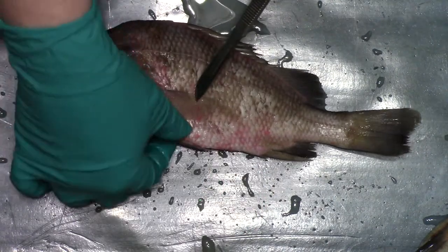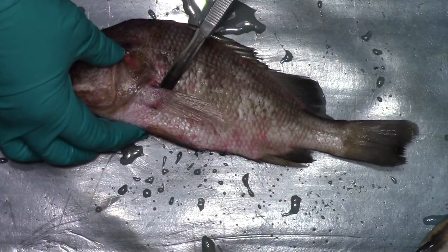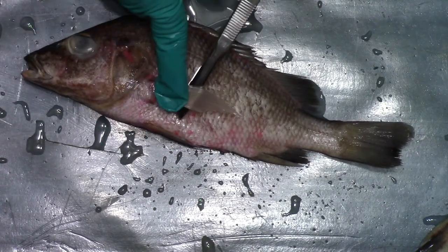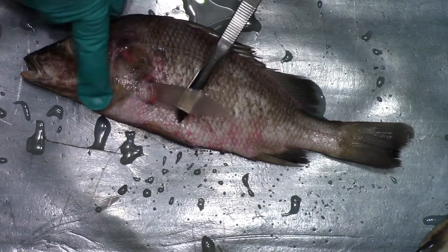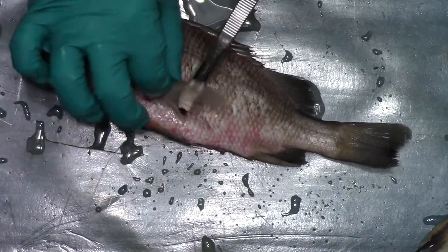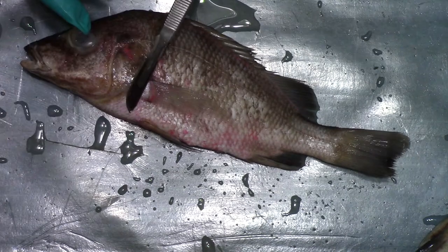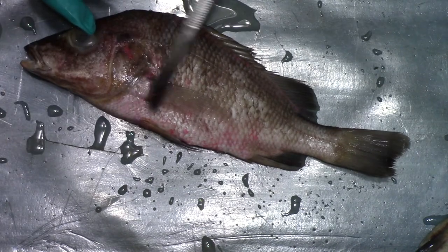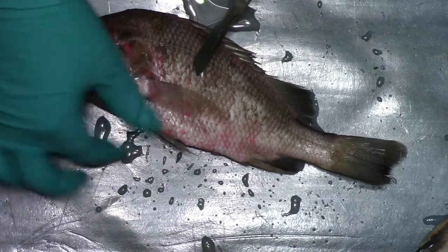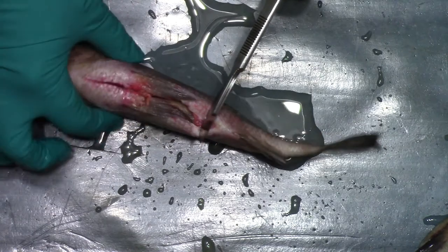What's really interesting about teleost fishes is that the pelvic fin has come forward, so it's just underneath the pectoral fin. Unlike the shark, it's not fleshy — there's hardly any muscle, just a little bit at the connector. So that's pectoral, and then pelvic is just below it. We always think of pectoral being at the shoulder girdle and the pelvic being at the hip girdle, but in teleost fishes it's come forward for better steering, giving them more mobility.